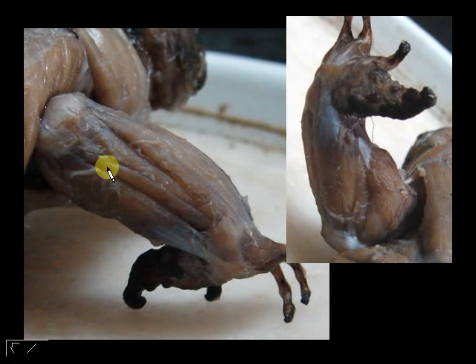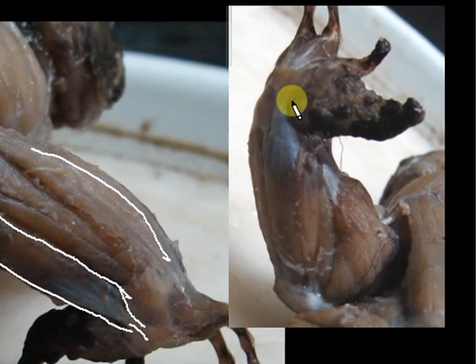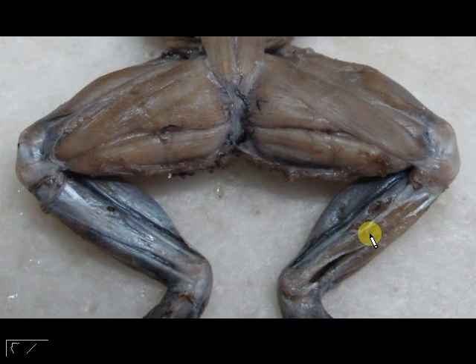Just a quick recap: here is the extensor carpi ulnaris, here is the palmaris longus connected to the palm — that's how you know. In this better view, you can see the palmaris longus and the small muscle there is the flexor carpi ulnaris, and the big triangular muscle is the flexor carpi radialis. So those are the six forelimb muscles, but at the very least you should know the palmaris longus and extensor digitorum communis longus.